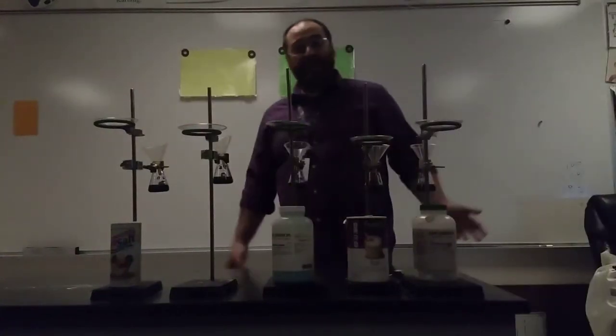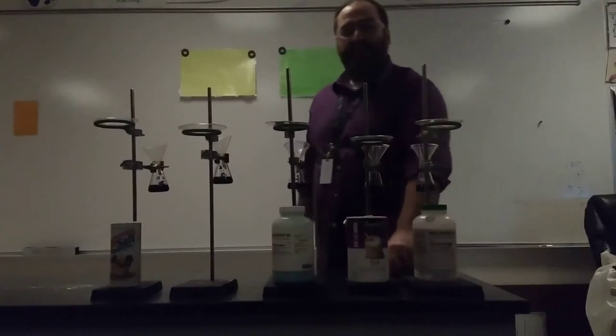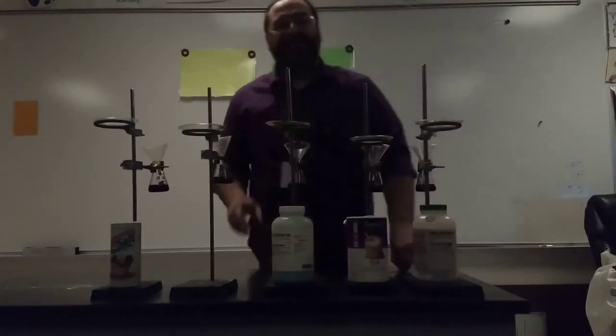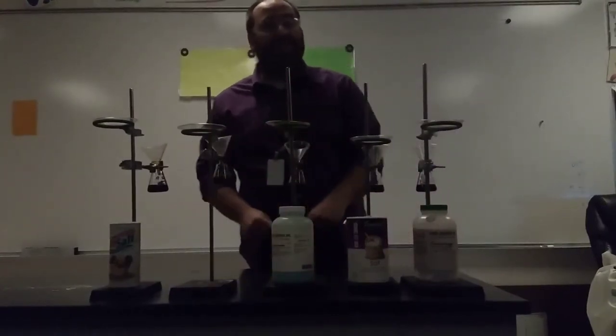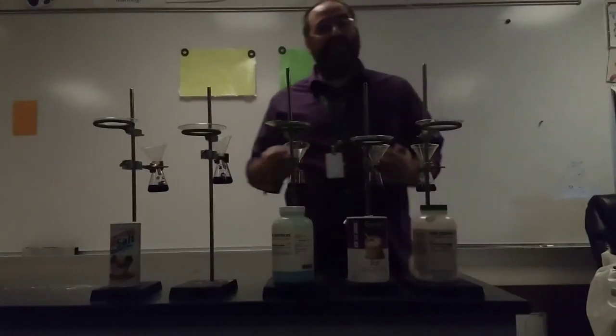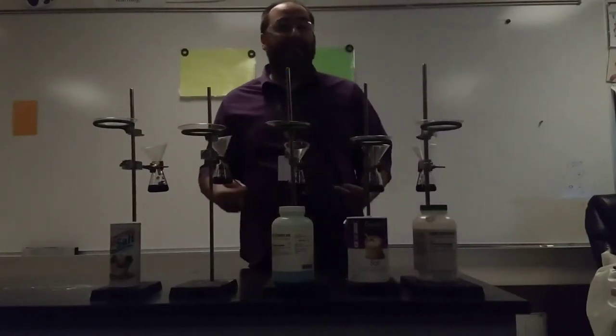Here I have a variation of the flame test that we've done previously in the lab. On each of these watch glasses are different salt substances that we're going to light on fire and see how their electrons react in a Bohr model.